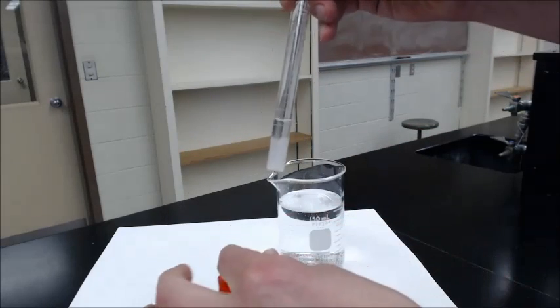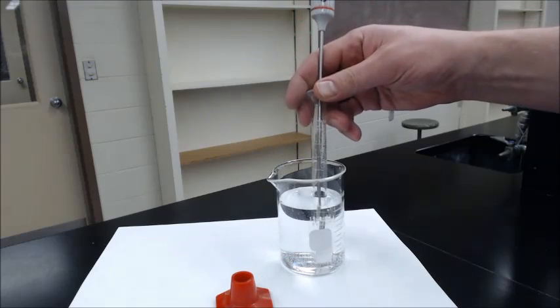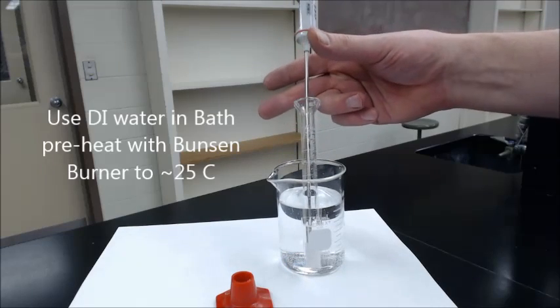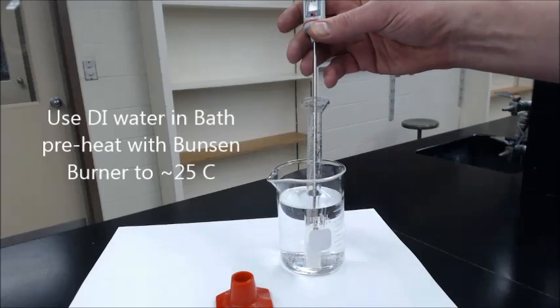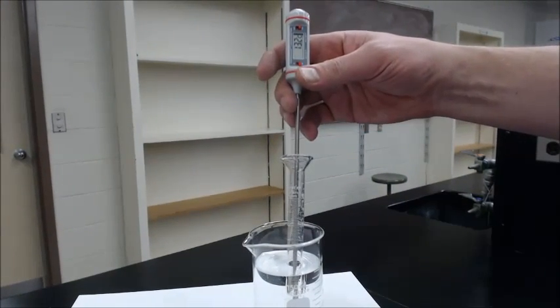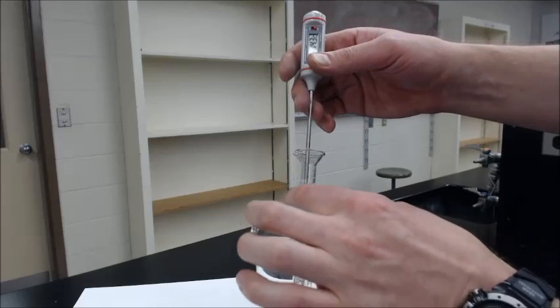Well, if you have a bath at 25 degrees, let's go ahead and use it. Let's go ahead and put the urea and the water in there, and let's warm her back up to 25 degrees.